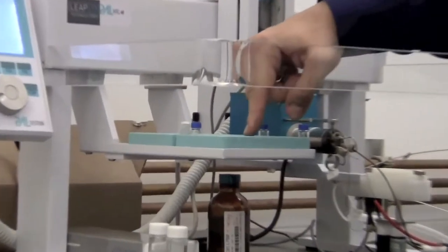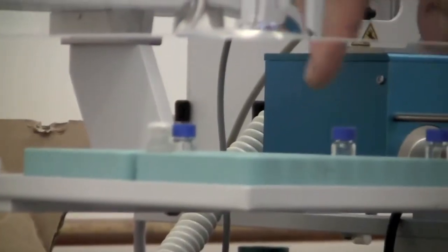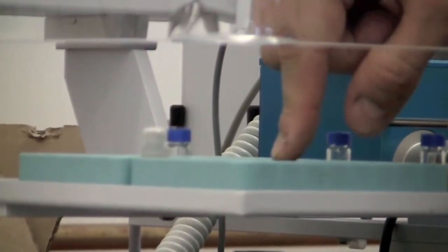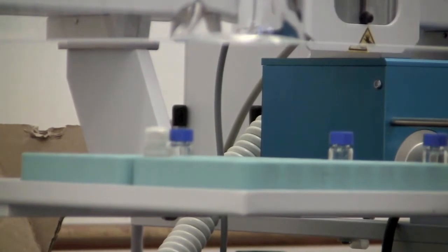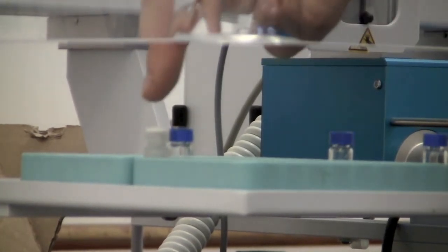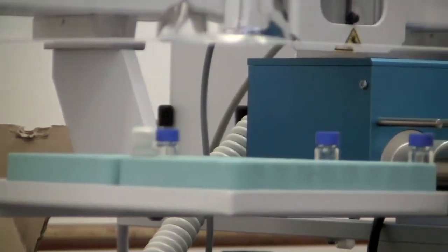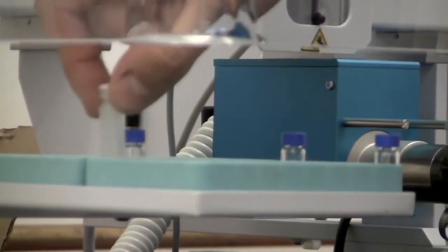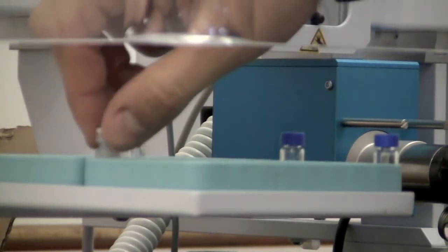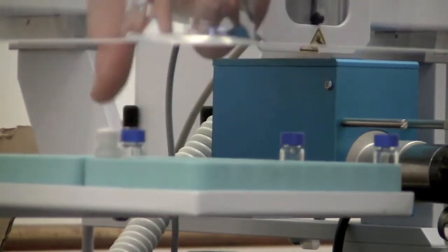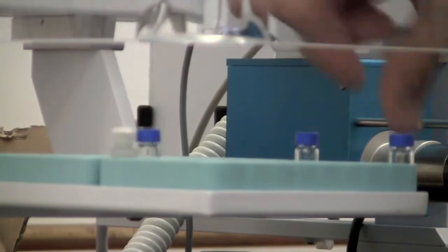Now there are two trays. This one is the front, this is the rear. It's important that whichever tray you put your sample in, that you match it when you load it into the software. The vials are numbered 1 through 54, so make sure that when you add your sample that the vial and the number that you load match. We're putting it in the front tray vial number 1.